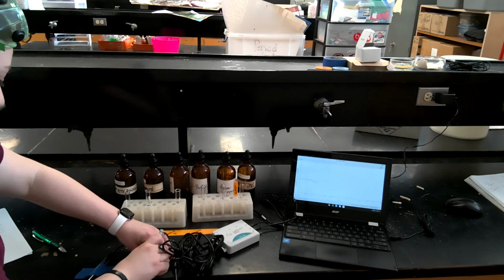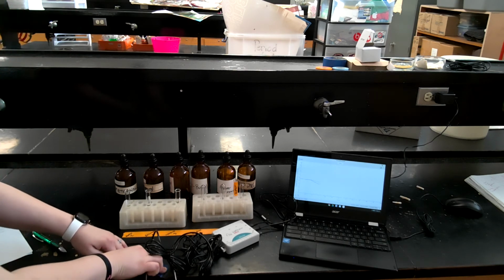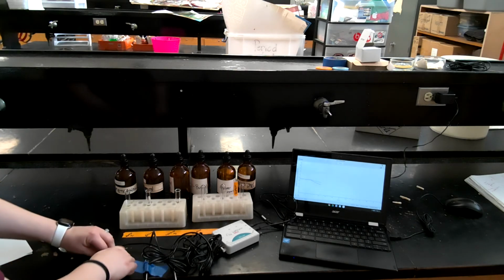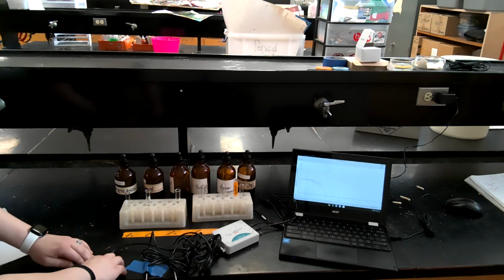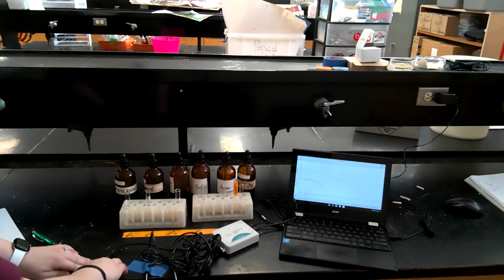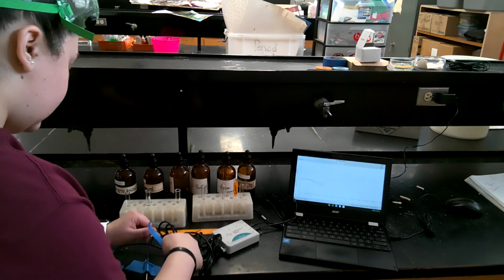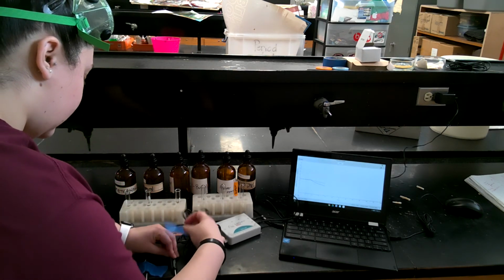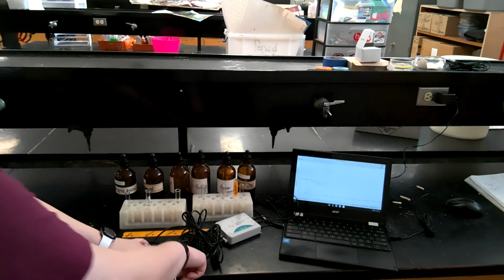And you want to make sure that you do not put the masking tape on the metal part of the probes themselves, because that can definitely influence the temperature, since these probes are highly sensitive. And you want to make sure that the probe part is not touching each other or the table as best as you can. Especially with the filter paper, that's why we have it over the edge.